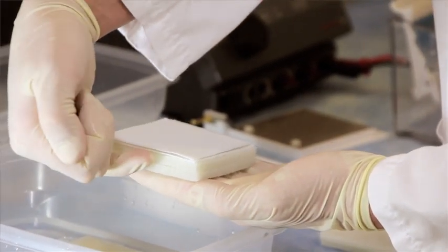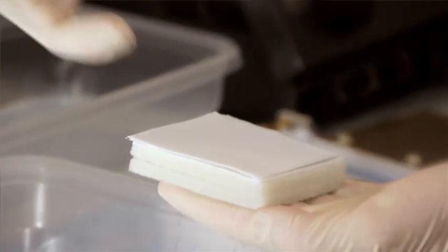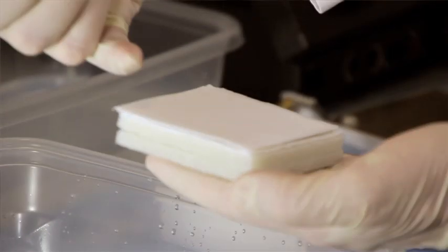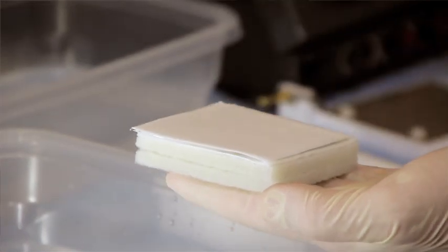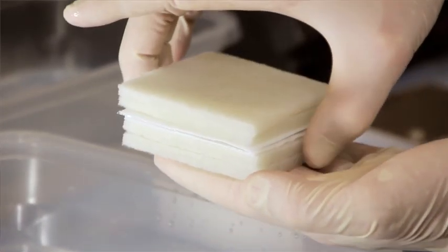gel, nitrocellulose or PVDF membrane, filter paper, sponge, sponge.